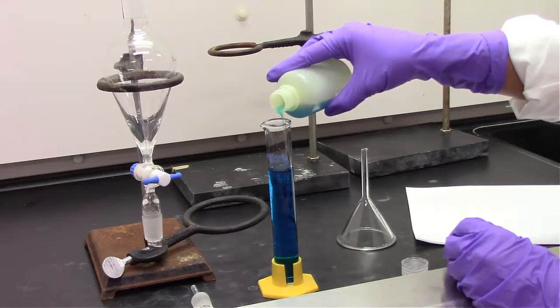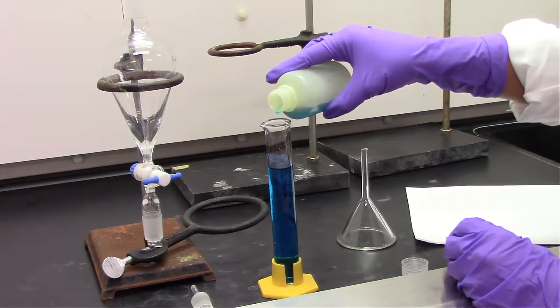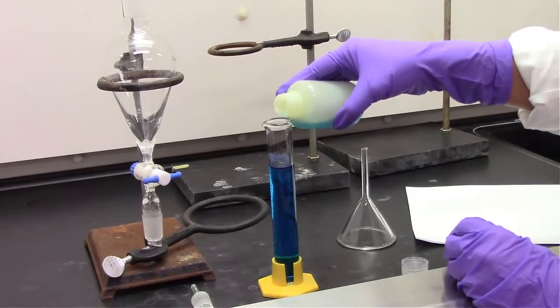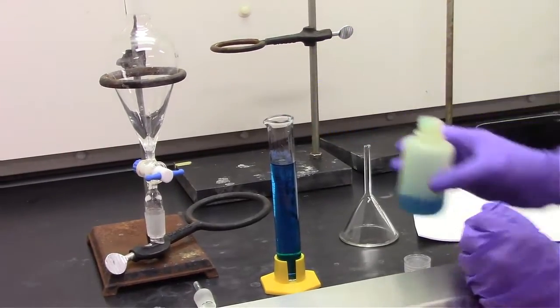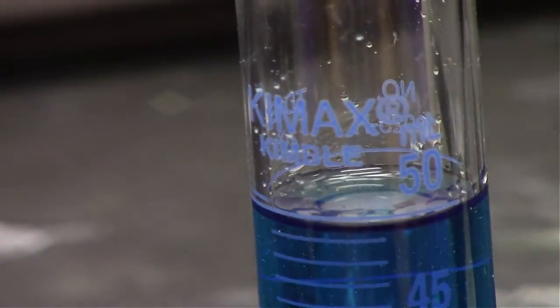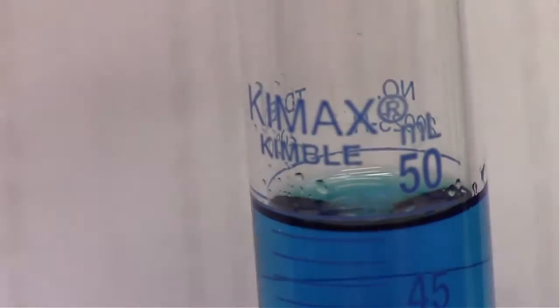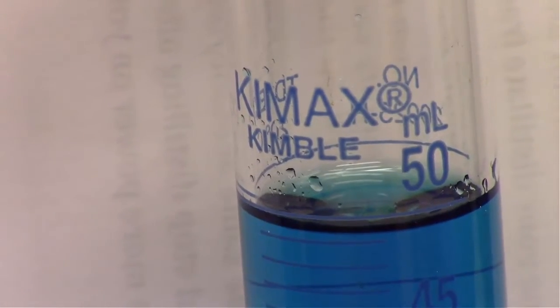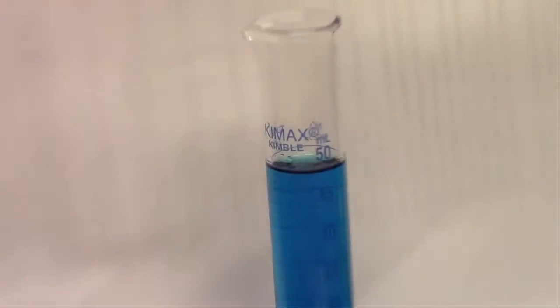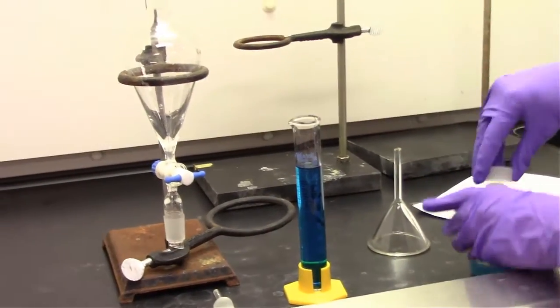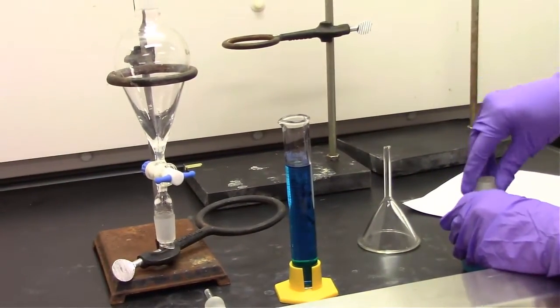Right now, the solution is being poured into a graduated cylinder, and we're pouring about 50 milliliters into it. We'll zoom in here, and now that it's clear, it looks like actually the meniscus is underneath that line, so if I was going to guess the volume of what's in there, I'd say around 48, but I didn't get a chance to look at it super closely there.